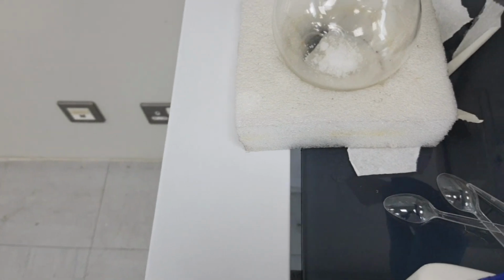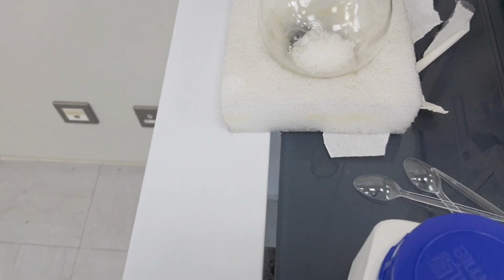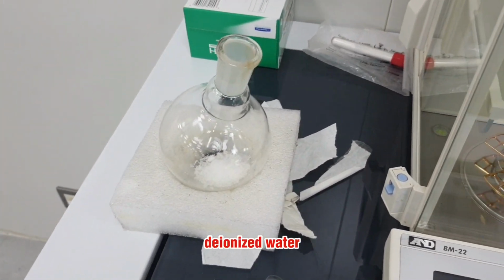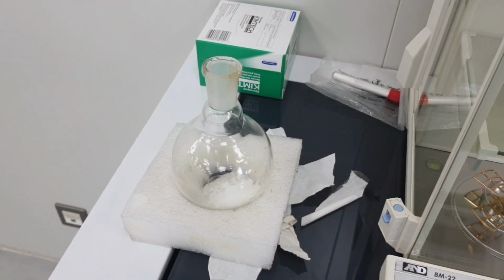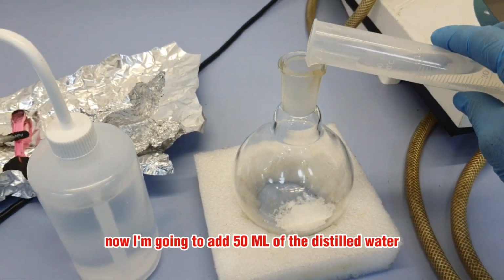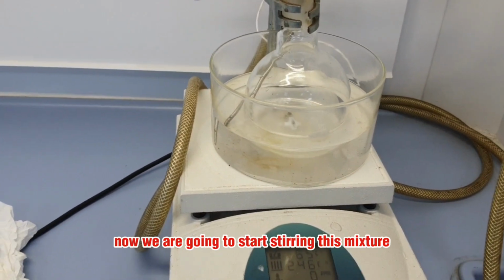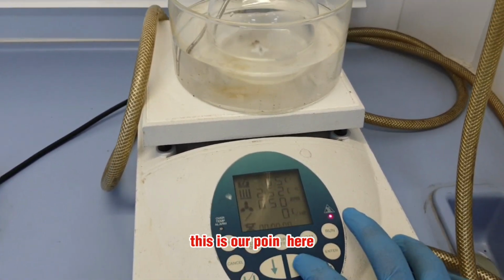Then we would add 50 ml of the deionized water, because all the calculation that we have done here is for 100 ml of the water. Now I'm going to add 50 ml of the distilled water, deionized water. Now we are going to start stirring this mixture. So what we will do, this is our RPM.